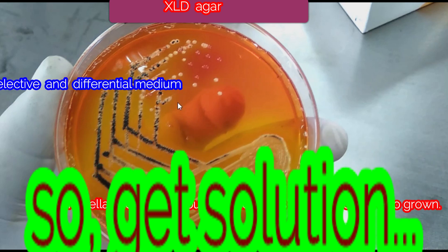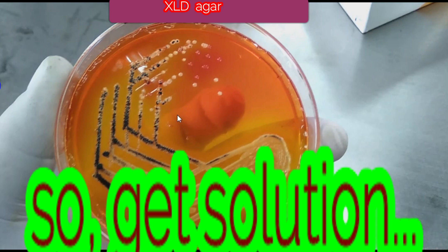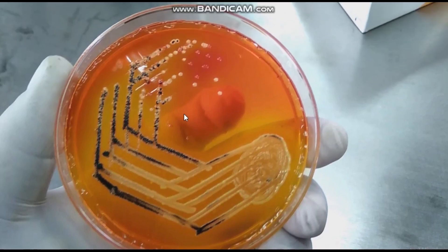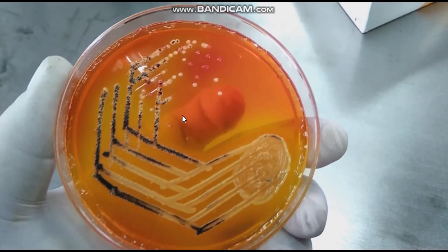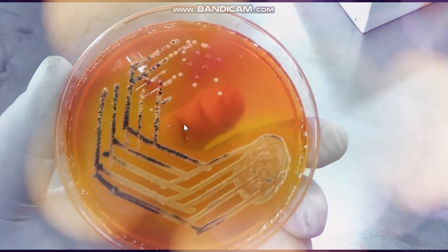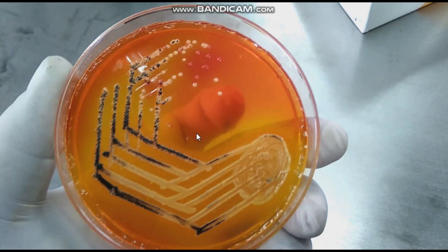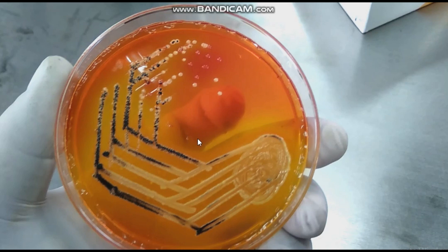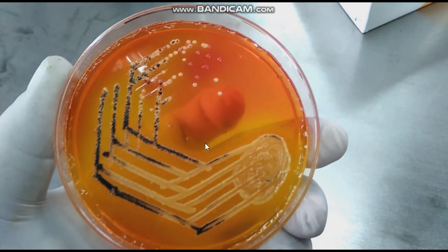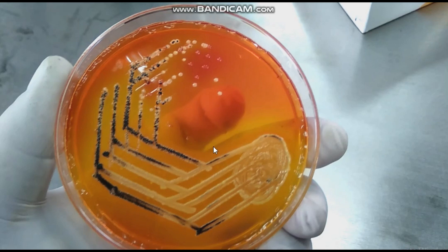XLD contains three sugars: xylose, lactose, and sucrose. Xylose is present in a lesser amount, whereas lactose and sucrose are present in comparatively higher amounts. Shigella will not utilize any of the three sugars.